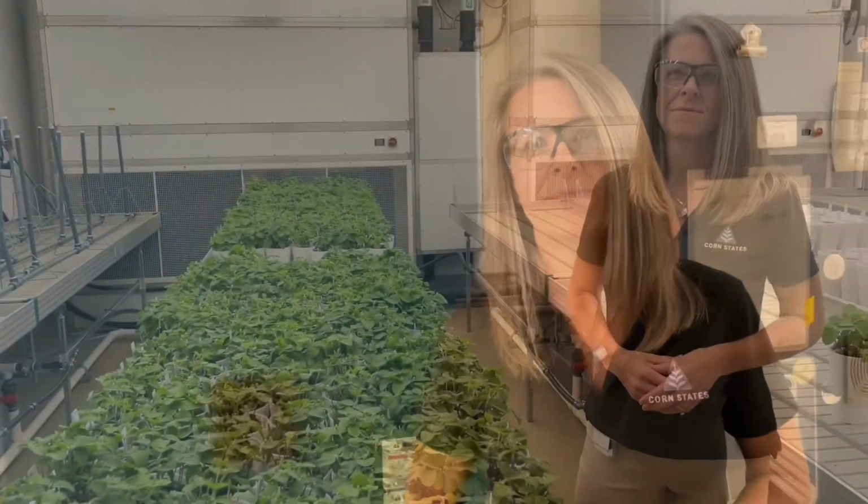So also what's very important is we have what we call partial resistance or field tolerance for Phytophthora. This is something that's going to kick in once those roots are established, and it's going to carry us all the way through the growing season. So Phytophthora tolerance is one assay that we do here in the controlled environment, and we can just walk inside a little bit and I'll show you how we do that and some of the results that we see.